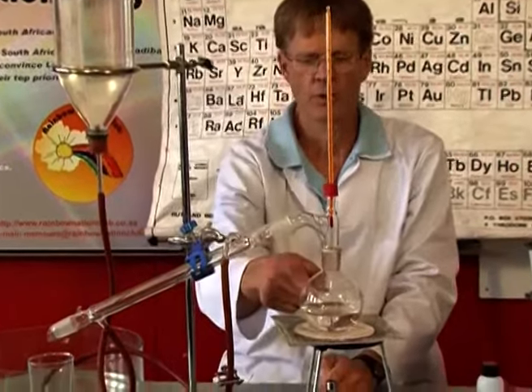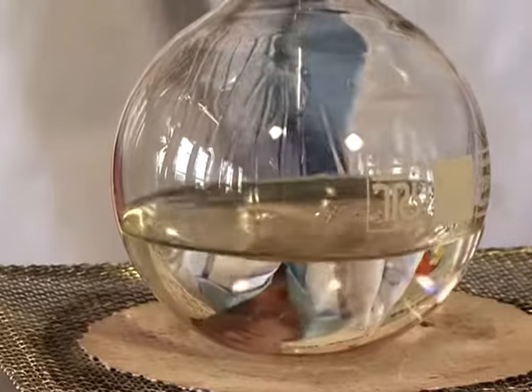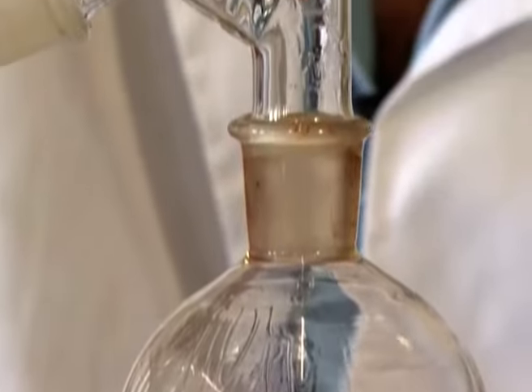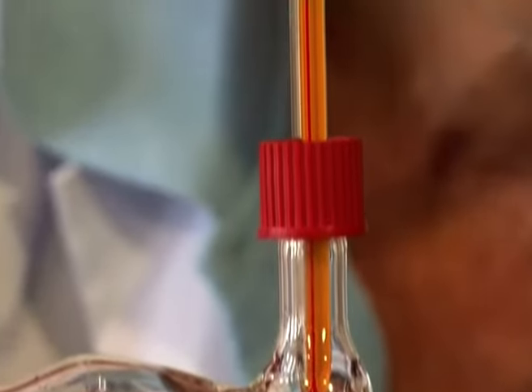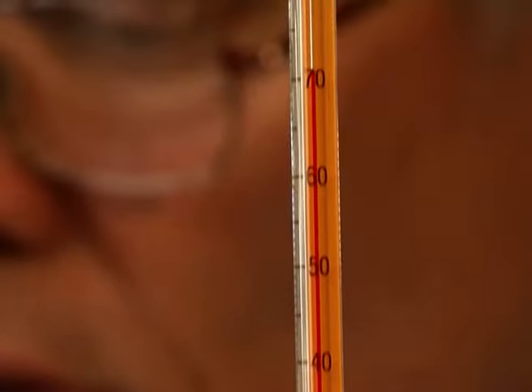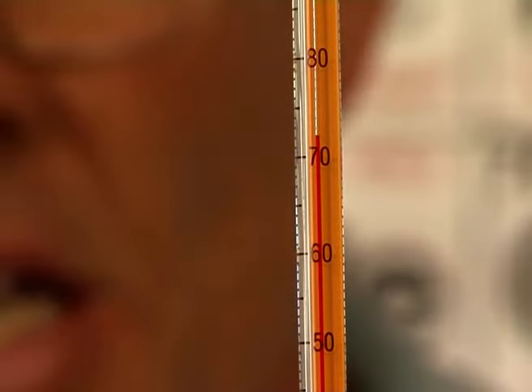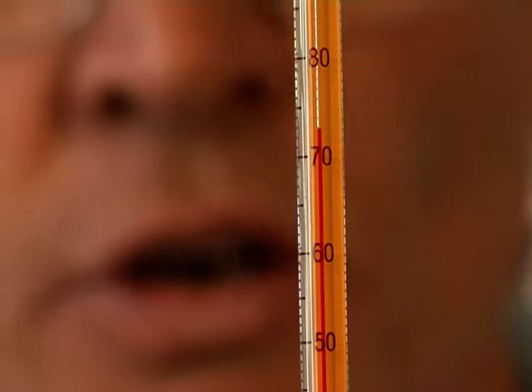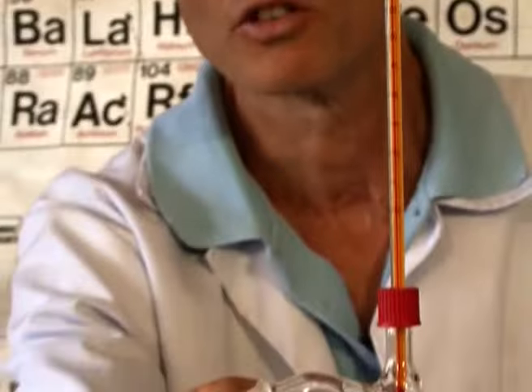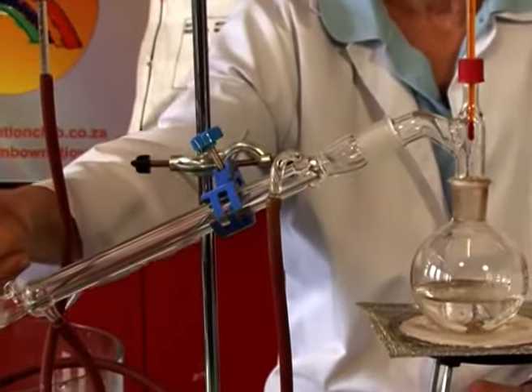Right, we've got it boiling now, and I don't want that to be too hot, but we should be able to see, if I open this, got the water flowing. It'll take a few minutes, but some of the vapors will not drop back in, but they will actually come down this side. There I can see a drop that's just started to move down. And in a minute or so, you will start seeing drops over here.